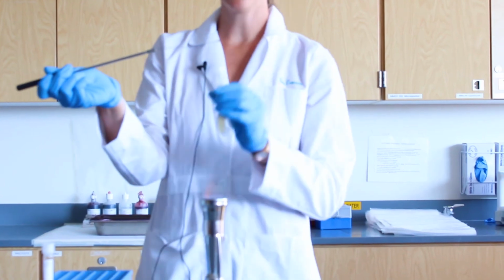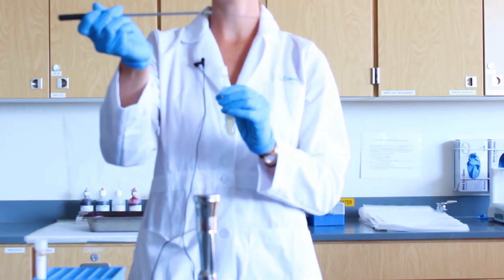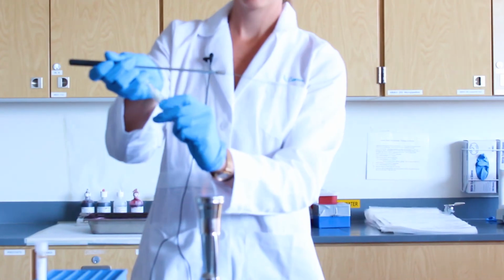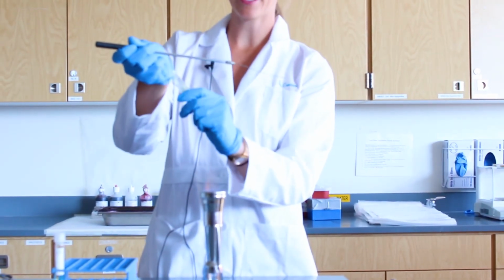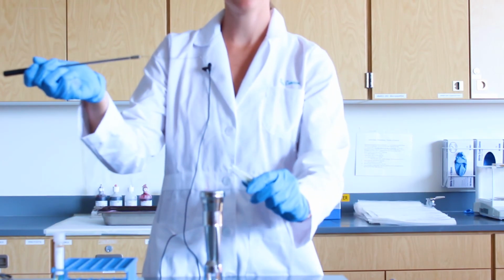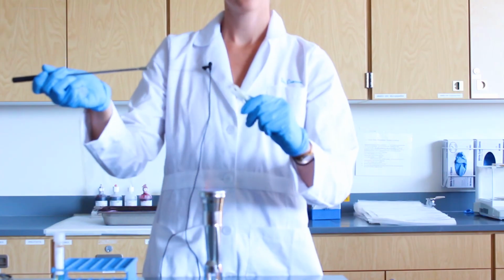You will now open your sterile agar slant. To do so, again, hold the loop in your dominant hand like a pencil and open the cap using your pinky finger. Make sure that the cap is always face down and that the agar slant is always at an angle. You will then pass the opening of the tube through the flame 2 to 3 times.